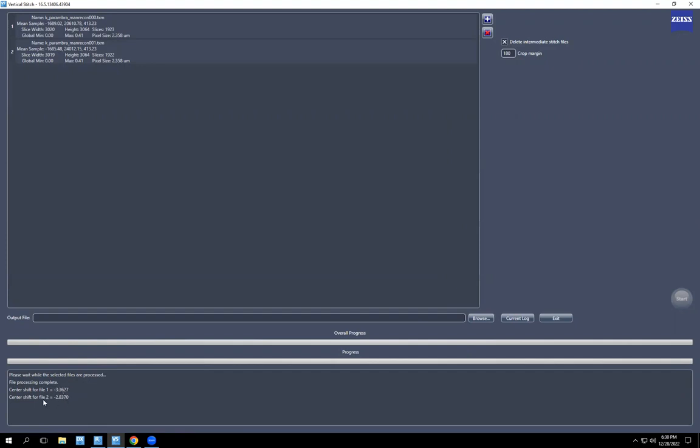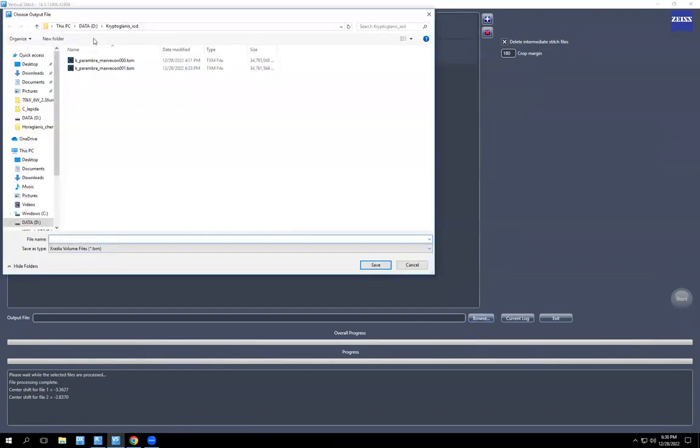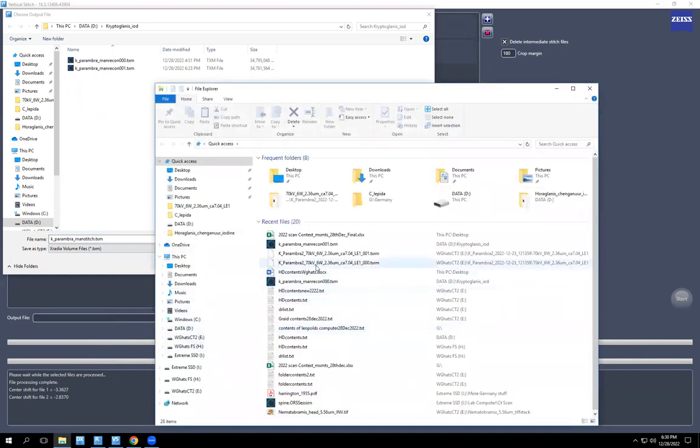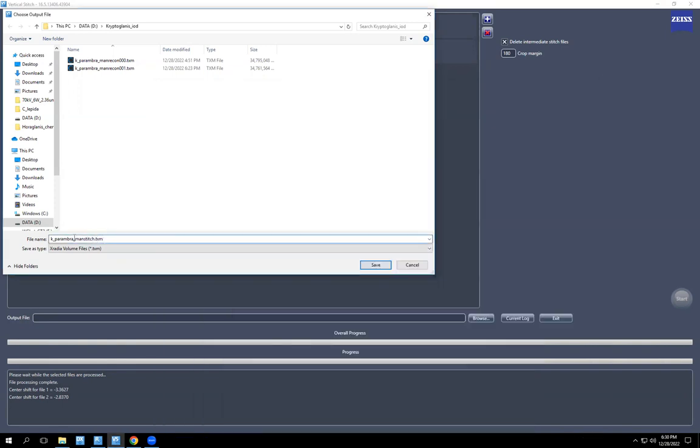Your center shift can be different, and it will be different almost always. But the byte scaling has to be the same. Now you have to browse and choose where you're going to save this. And I'm going to save it in the same spot. And stitch. At this point, I would prefer to also give it the other information. So at least the voxel size, 2.36. And probably the scan number, but I'm not going to worry about that now. So I'm just going to save this.